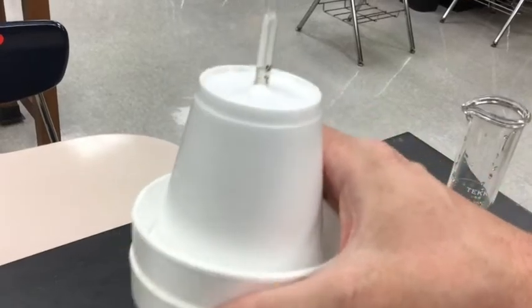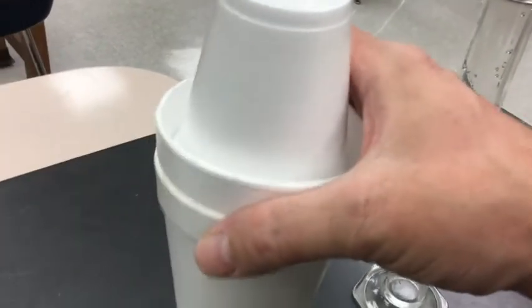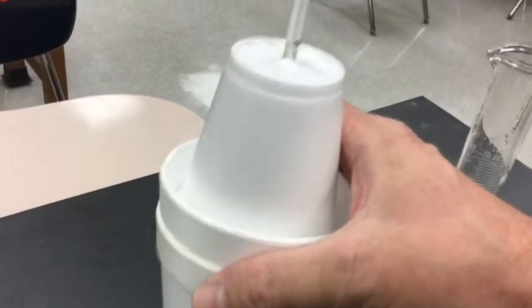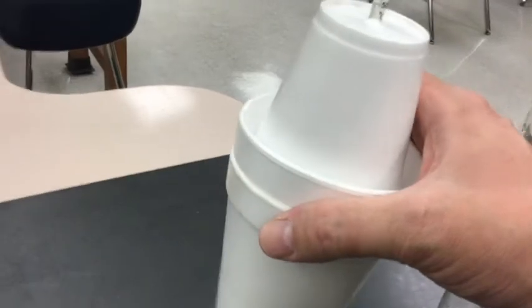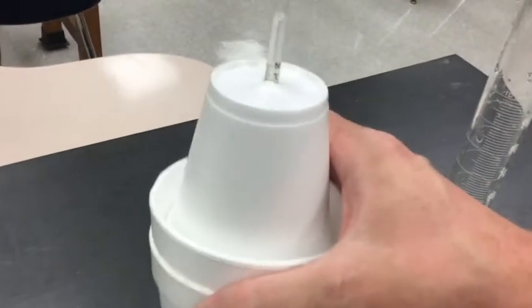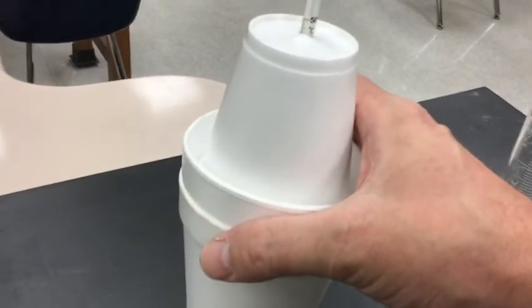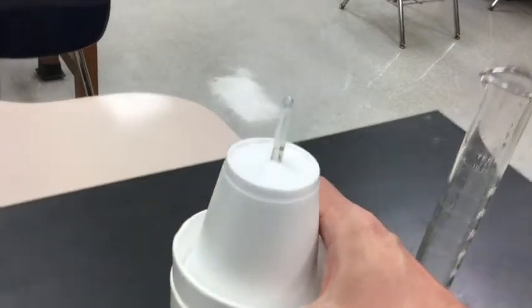And as this gets stirred up, you are going to see an exothermic reaction occur, and the energy is going to be given off by the chemical reaction and absorbed by the surroundings, which we are going to assume is our water, the aqueous solution of our hydrochloric acid. And again, we're making a bunch of assumptions here that are not quite true, but are pretty close.